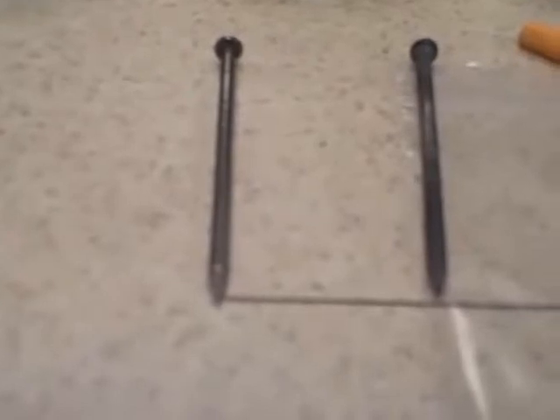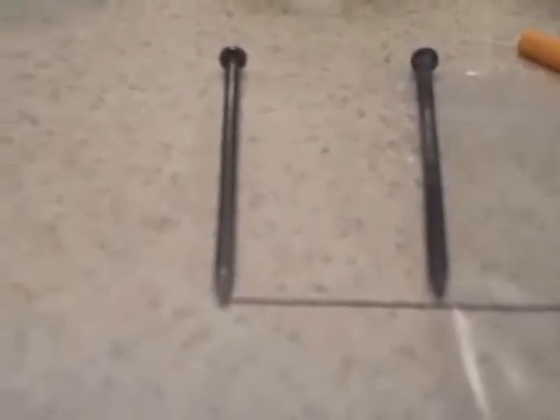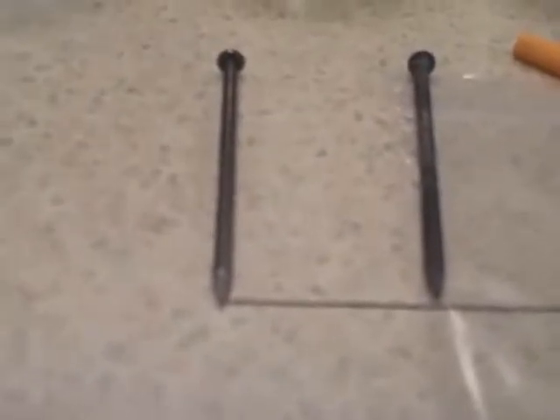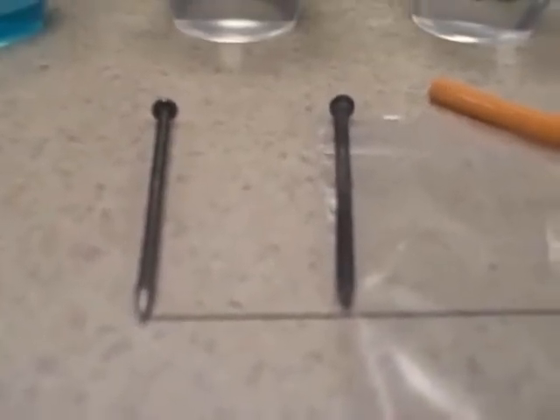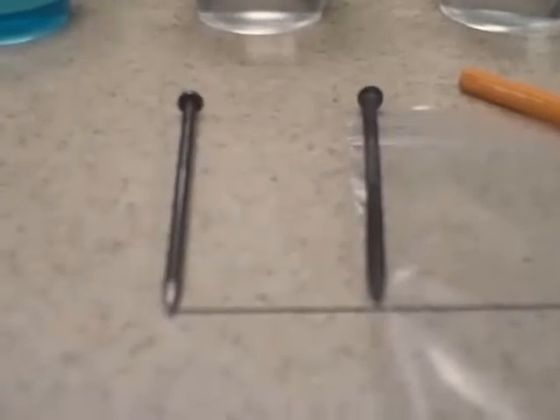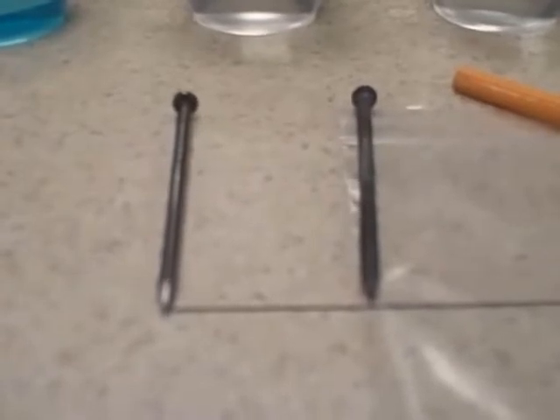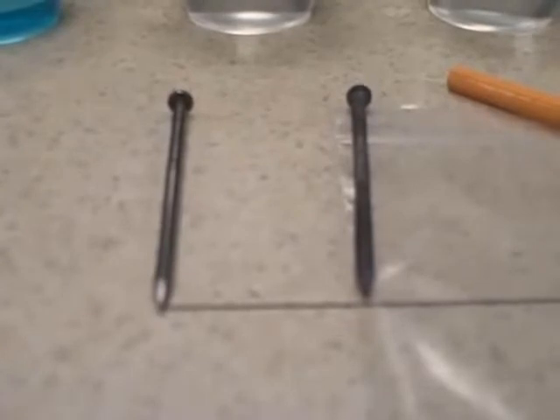I'm not sure it's there, but if not, take a paper towel, get a couple double thickness paper towel, lay it down on the table, lay the nails out on that paper towel, take a second double layer paper towel, and rub the zinc coating off. It's probably oxidized zinc at this point from being in the vinegar. Rub it off onto the paper towel.